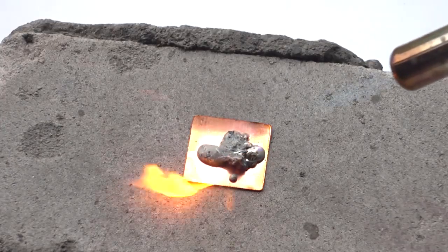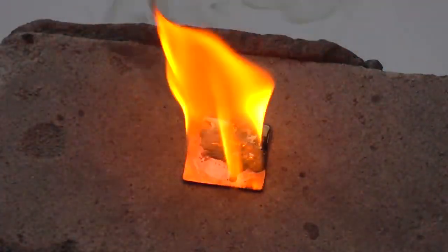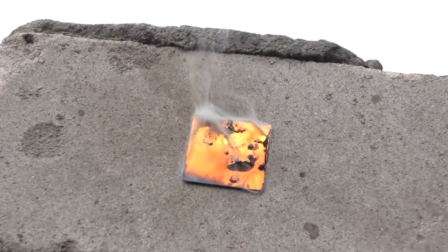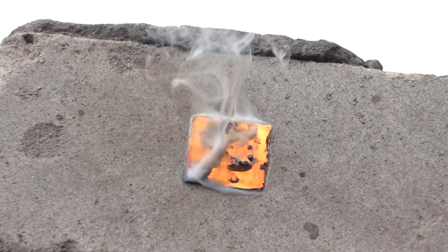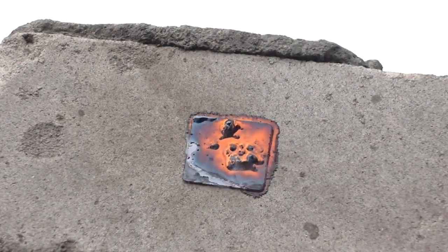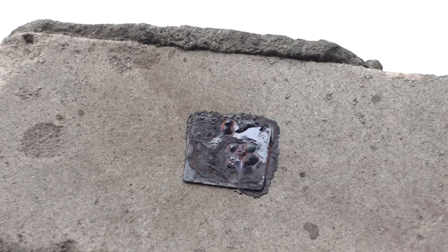Also, we decided to fuse copper with cesium. With that, an unusual compound was formed, the intermetallic compound of copper and cesium, which eventually decayed due to cesium's oxidation by atmospheric oxygen.